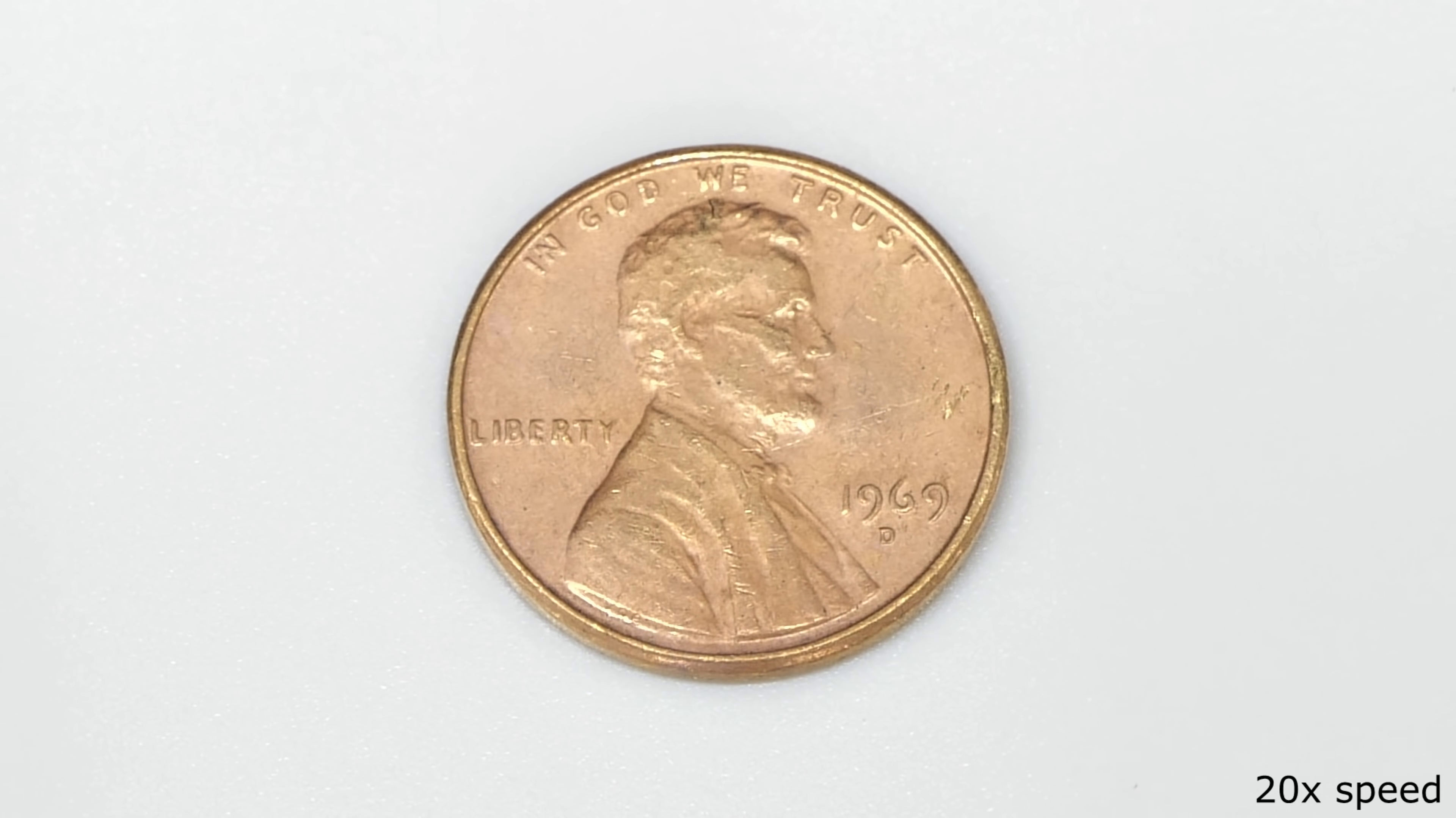As it warms up, it slowly changes color, and eventually, it's completely gold.